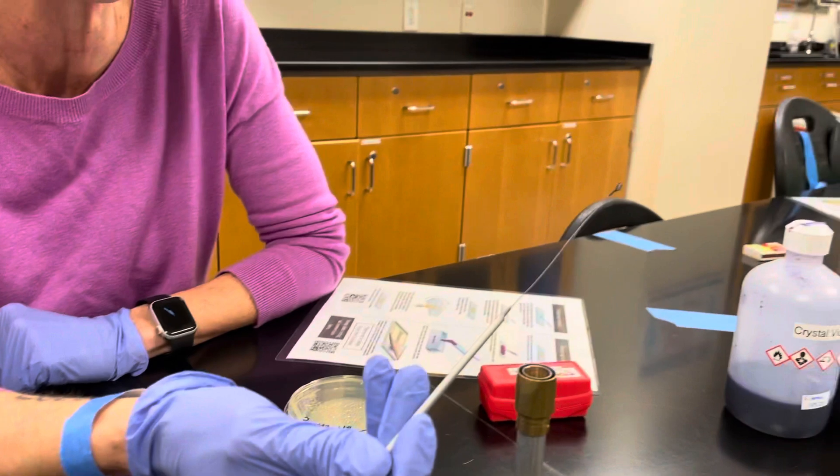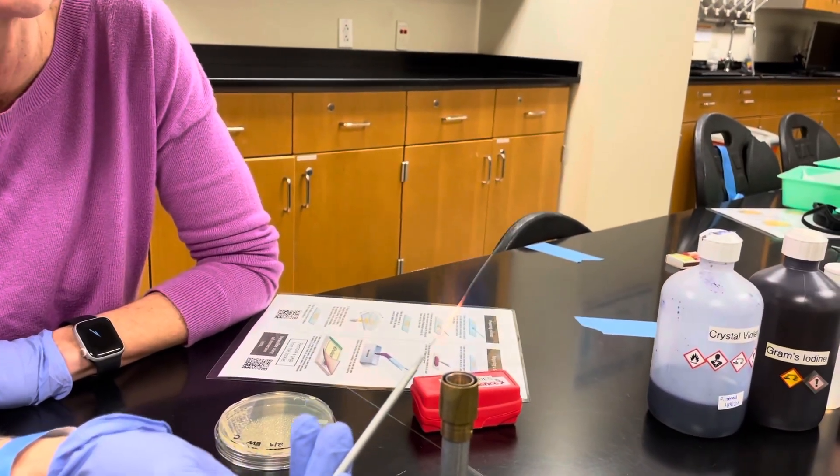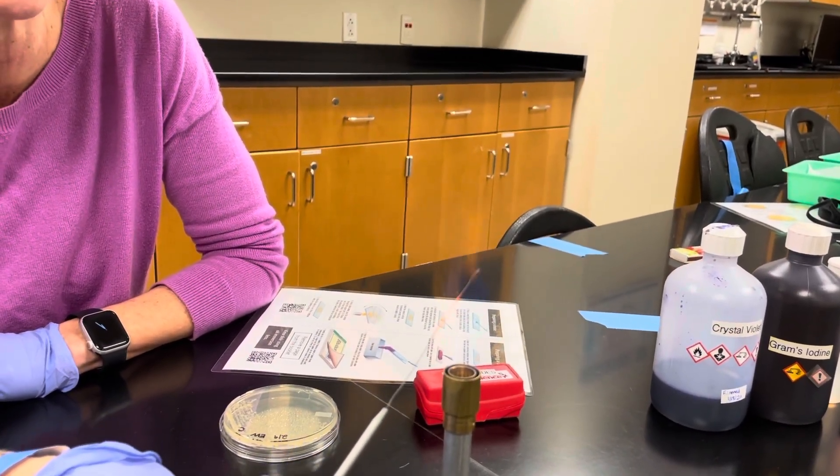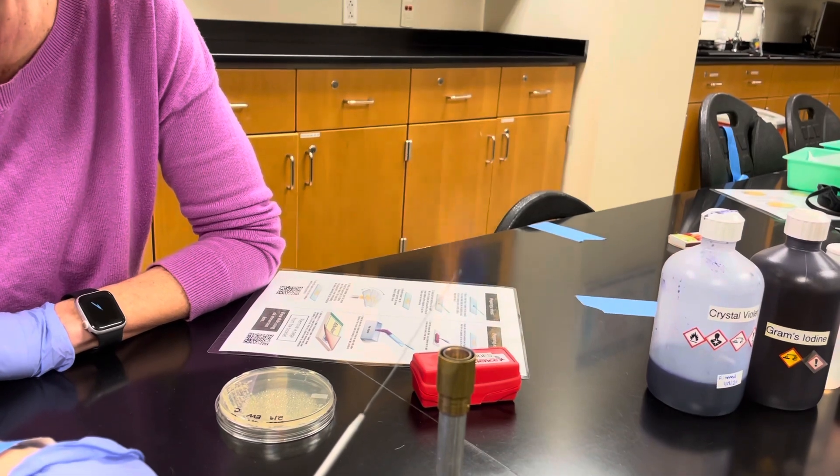We're going to sterilize our loop once again from the base to the tip. Hottest part of the flame. Let it glow.